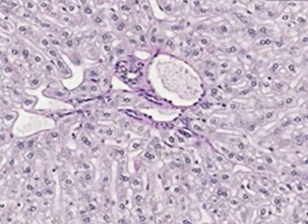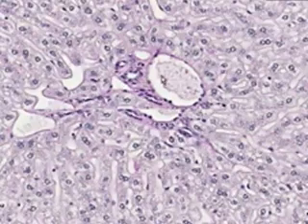We could see probably a hepatic artery branch. So that's why they call it the triad. The hepatic artery, the large portal vein, and the bile duct. That's what makes it a triad. Also, please notice that there's some connective tissue here, which is pretty well delineated from the surrounding hepatocytes. In central veins, there is no fibrous connective tissue around the vein.